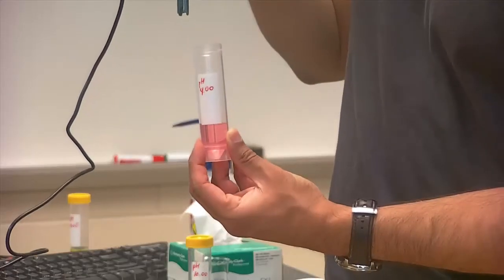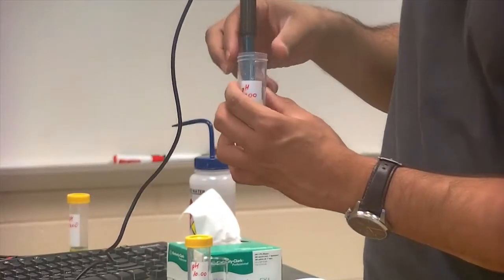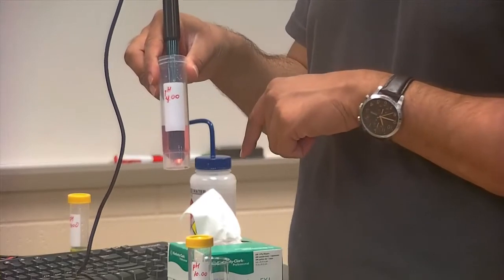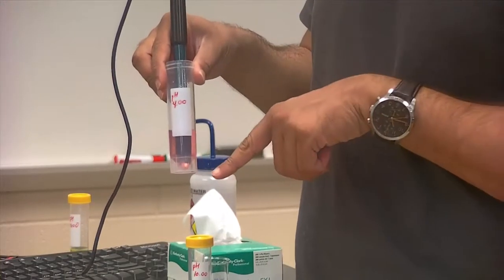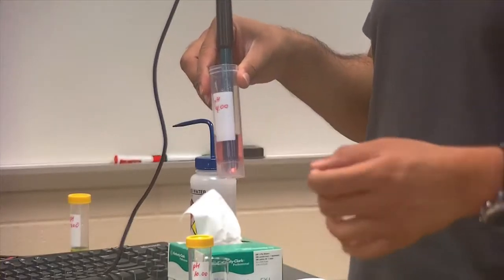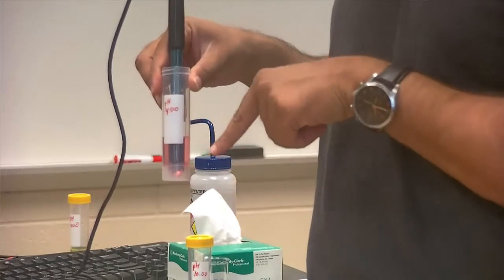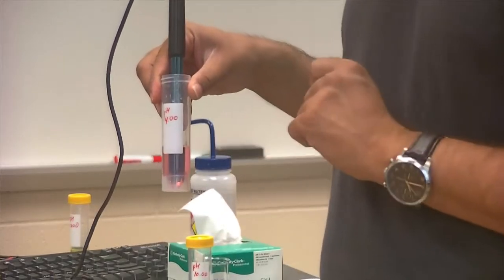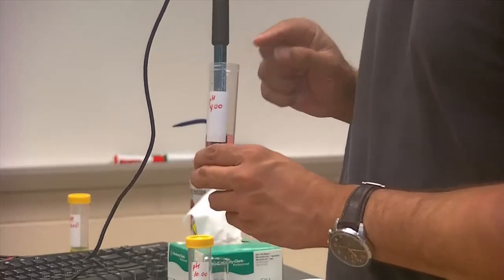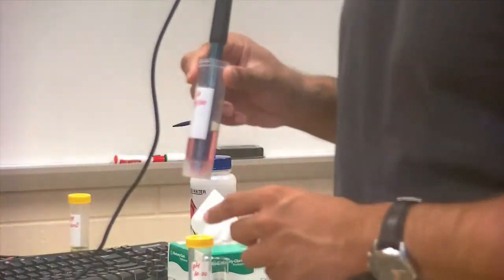All right, here's my pH 4 calibration buffer. I'm going to soak it in there. You may want to put the calibration buffer in a separate beaker, a secondary container. I've inserted the pH electrode directly into the primary container. Probably good science would tell us to put this into a secondary container, but that's okay because I've stored these already, and I know these are pH calibrated buffers meant for calibrating pH meters. So put the pH electrode in.